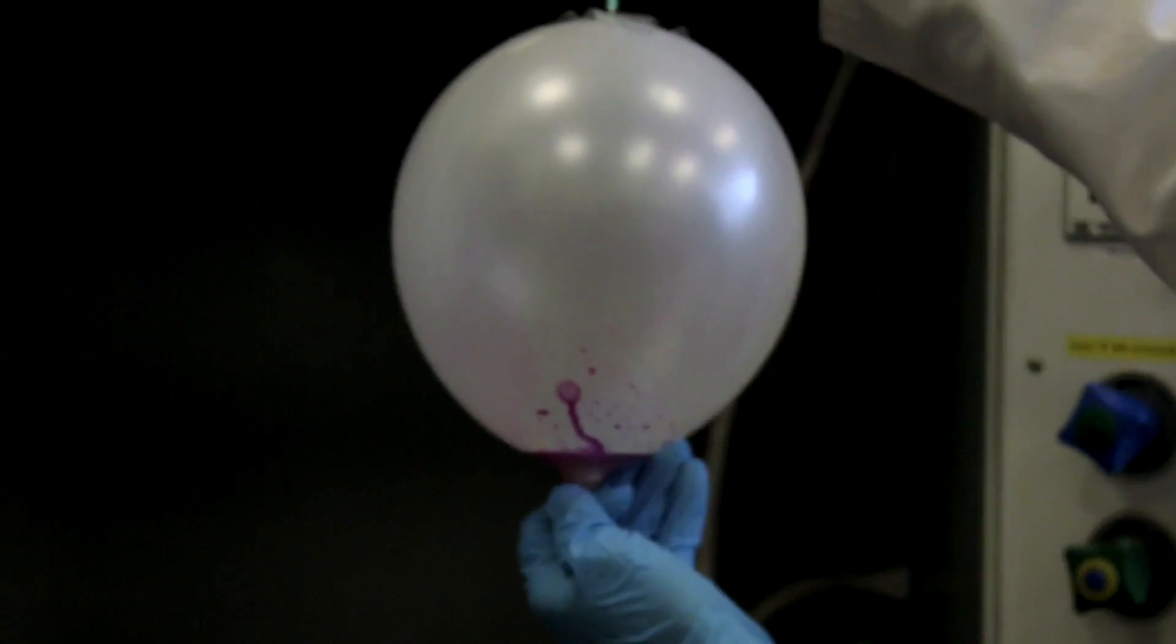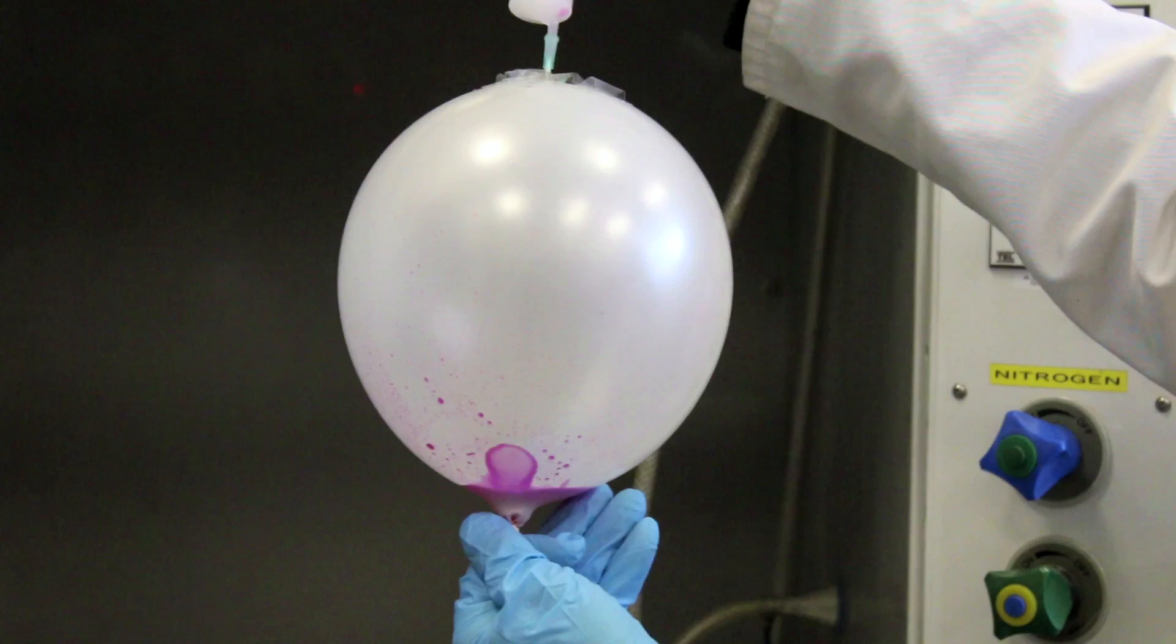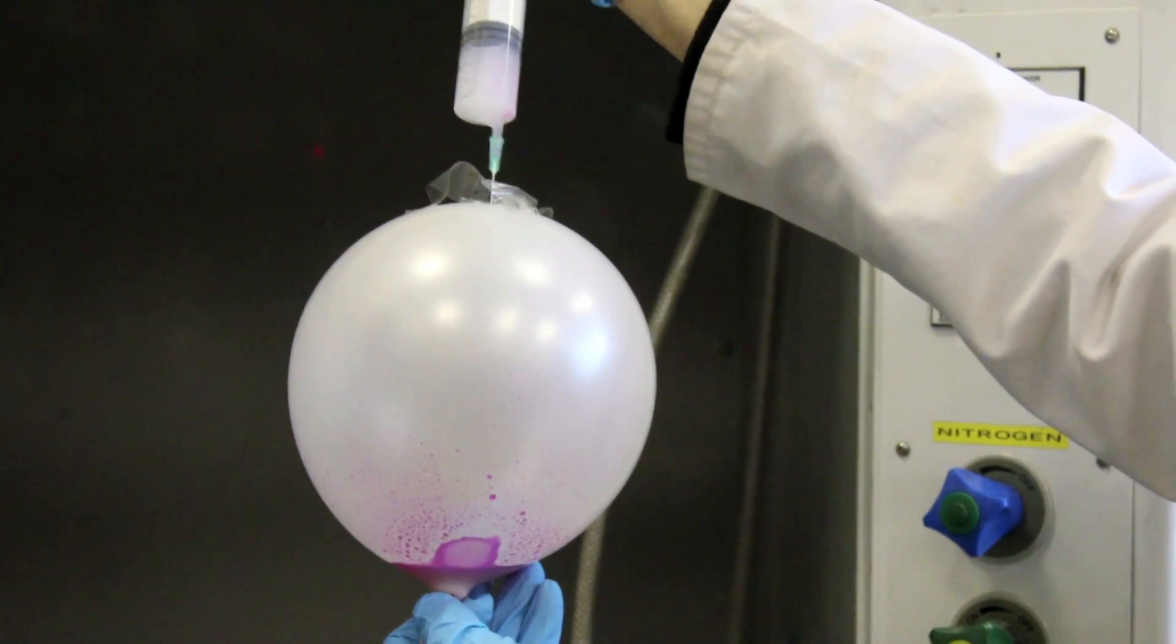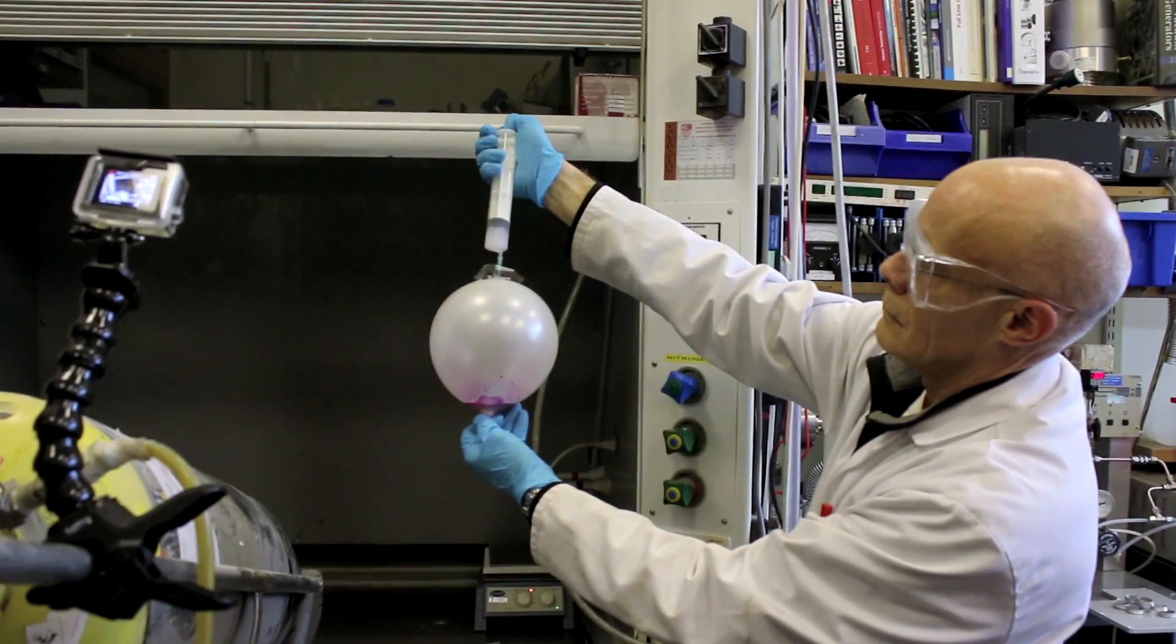When the liquid went in, the ammonia started being absorbed and the balloon beautifully shrank. But what we didn't realize, because Neil was holding it, was that when ammonia dissolves in water, it produces a lot of heat.